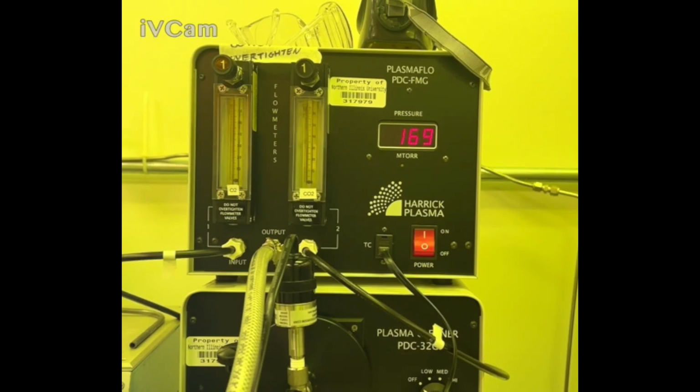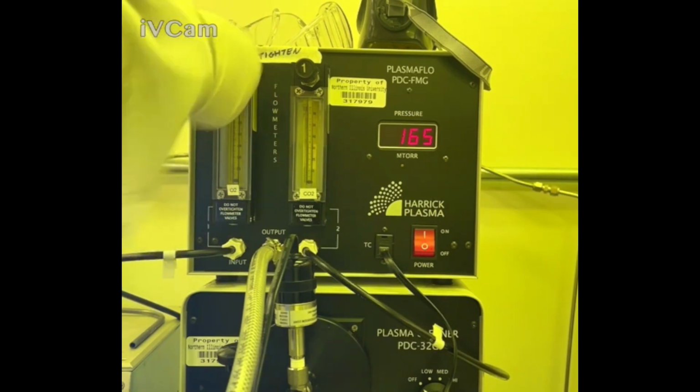So it does not have to be exactly 150. You can start pumping in oxygen now, but if you would like it to be exact, you can wait longer. I am going to start pumping in now just to go through the instructions. The next thing I'm going to do is I'm going to take the oxygen valve and then I'm going to open it up all the way.